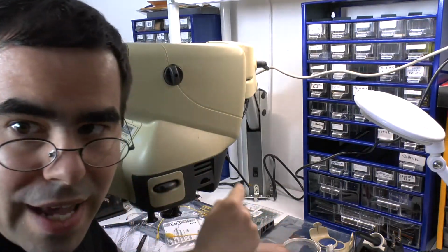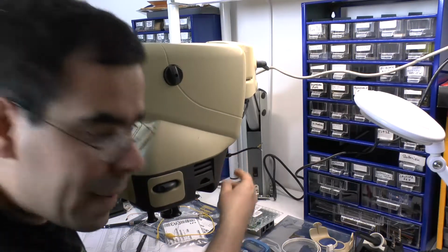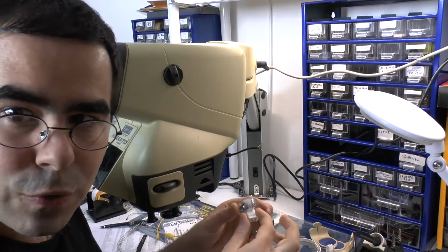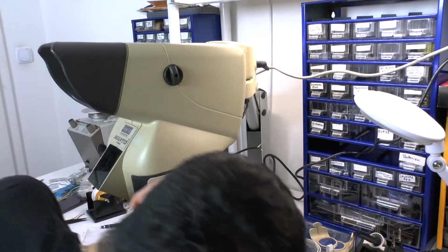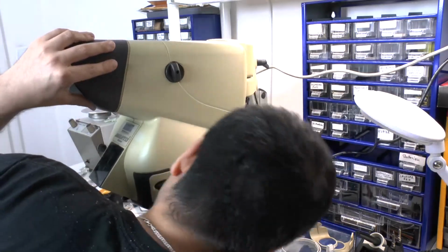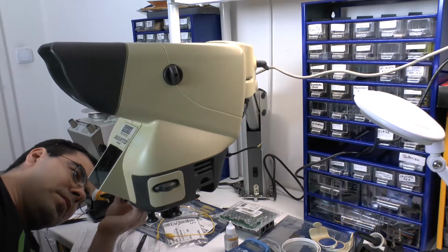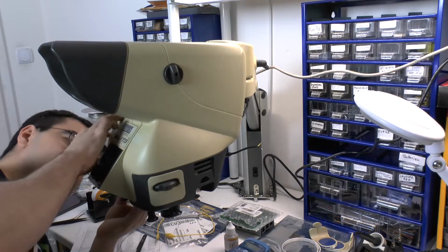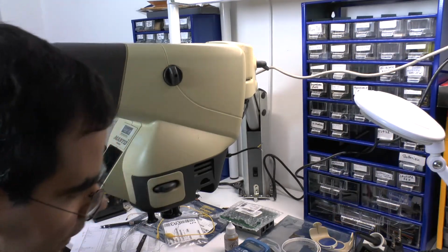And I found online that this thing, in theory, works with alternating current. But for now, I believe direct current should also do the trick. And we are gonna see if we can get the lamps up with a power supply in a quick and dirty fashion. So we're plugging one of them in again, plugging the other one in again. And then it's time for the power supply.